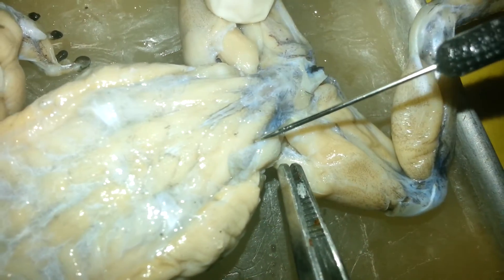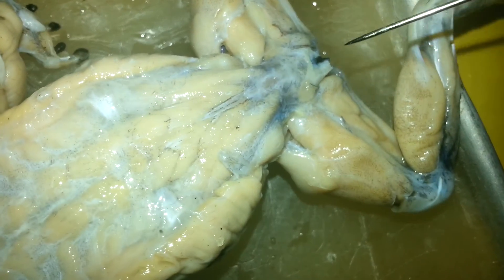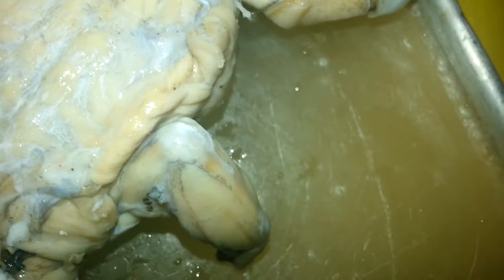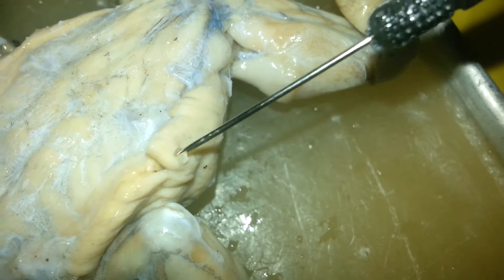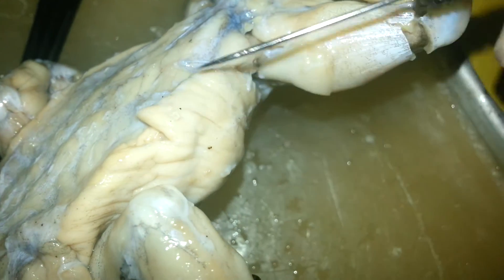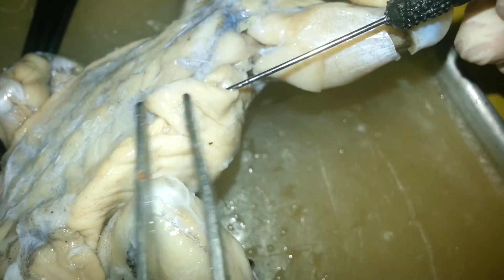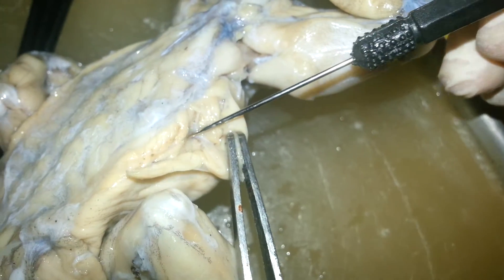Sacralis and the iliacus — you have a division there. External oblique — from the side. Under that, cut by the internal oblique.